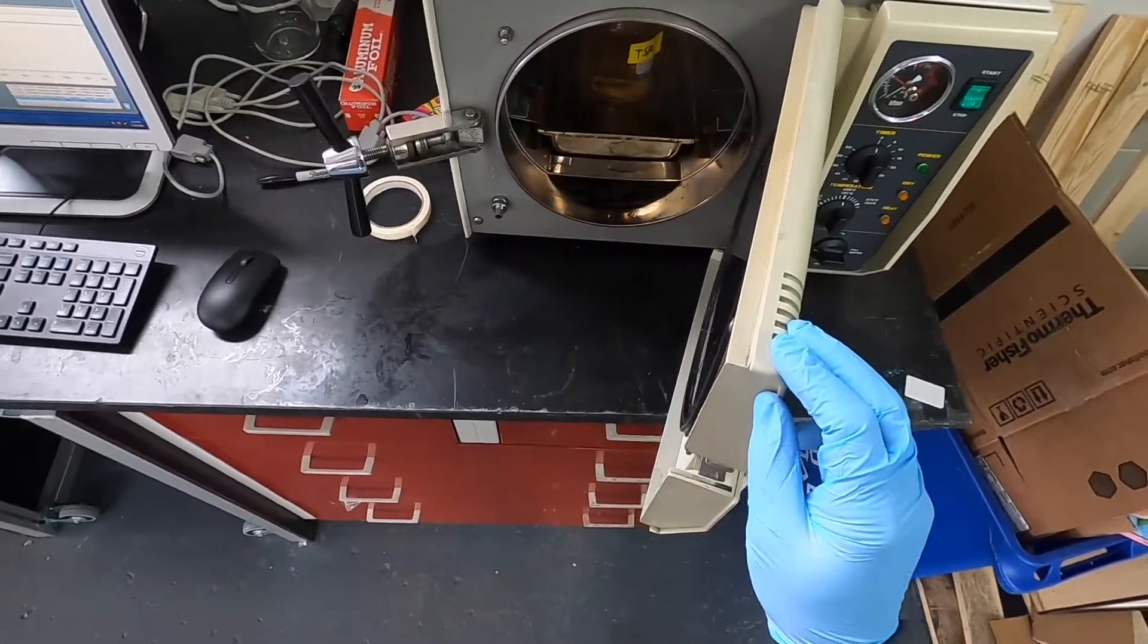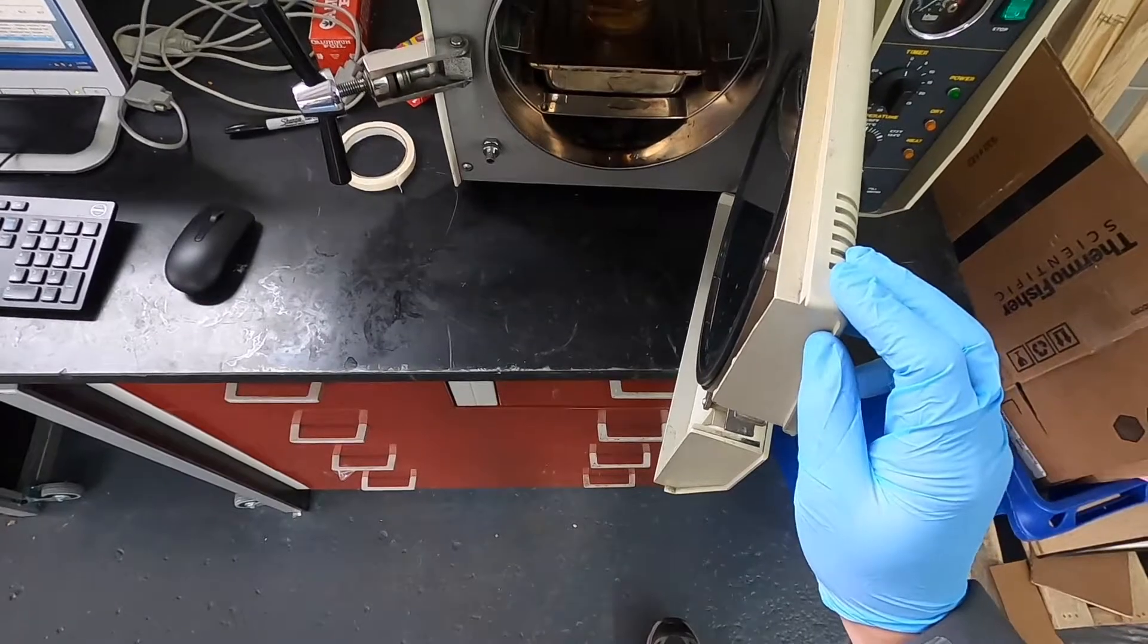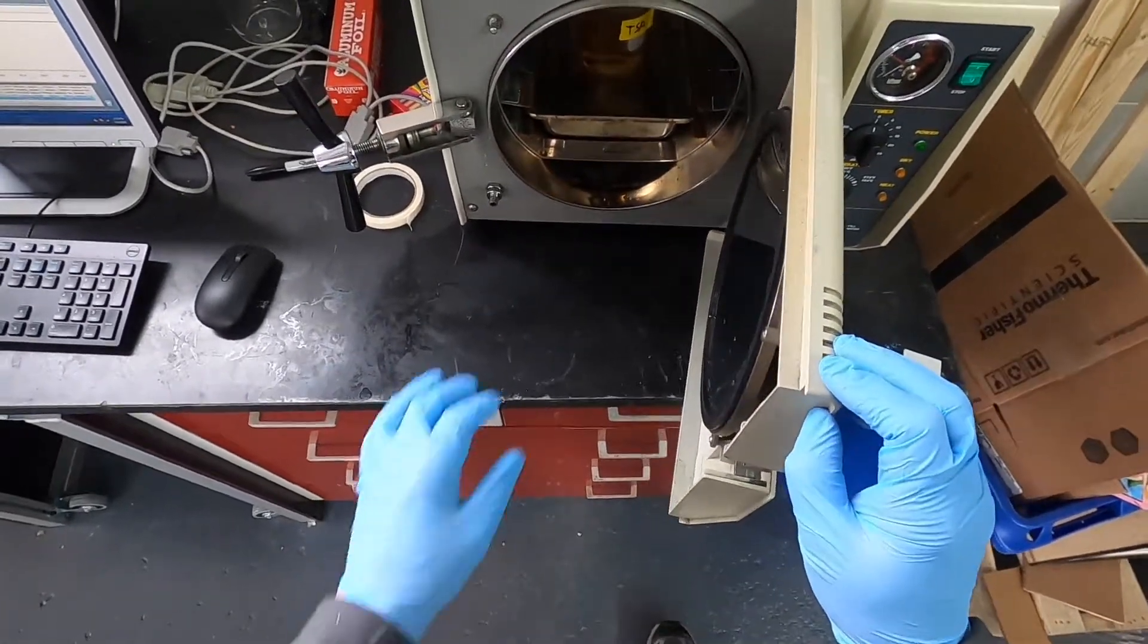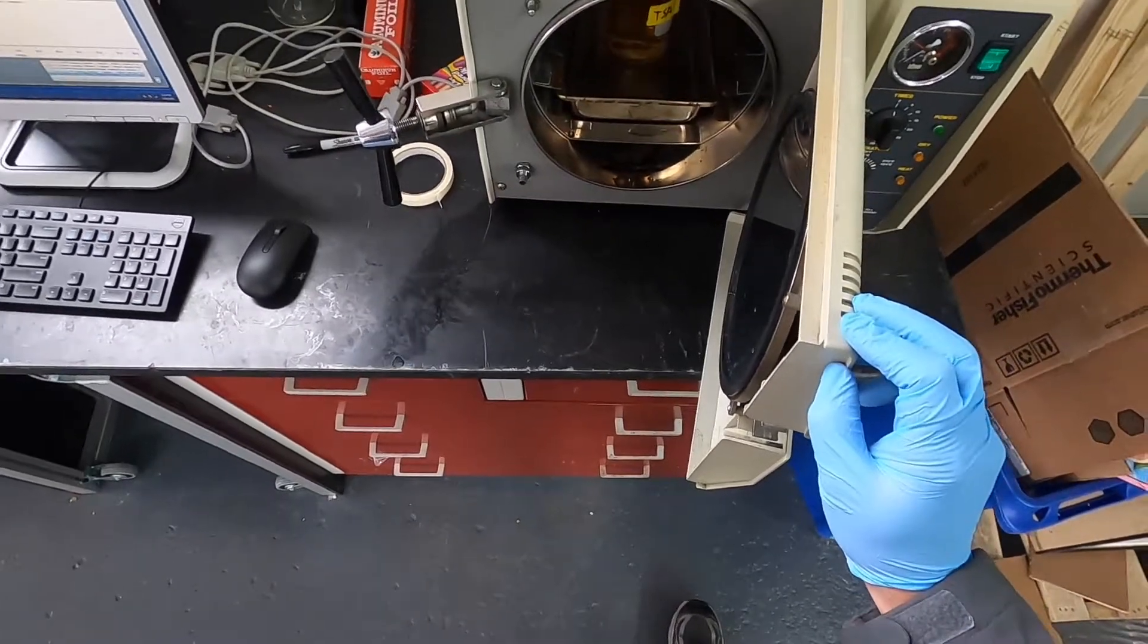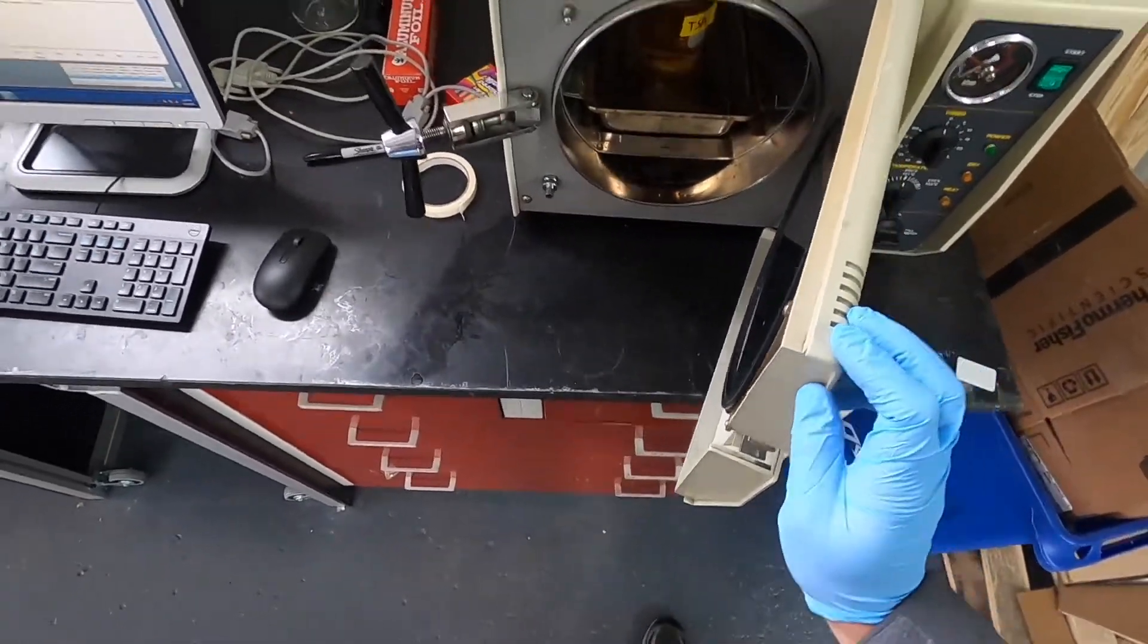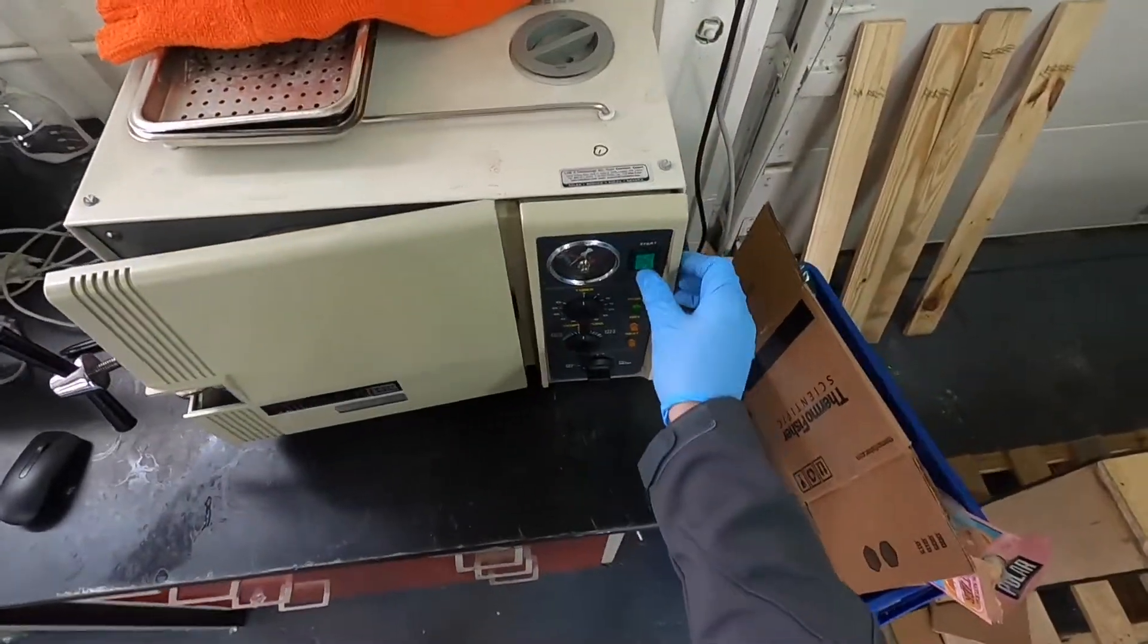So it's pretty hot and boiling over there. So this is why it's also good to let it cool down naturally and not force it, because it's super boiled right now. So any disturbances will cause that to boil over, and that's where you can get hurt. So we're just gonna leave this alone.